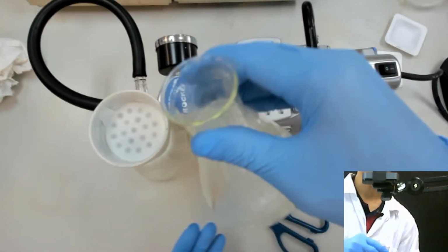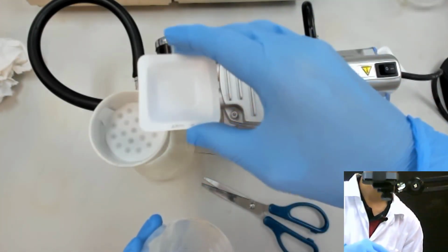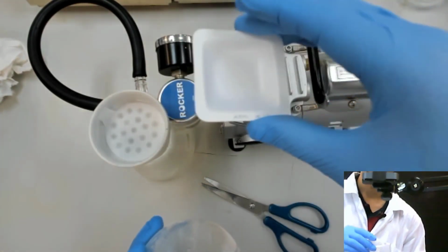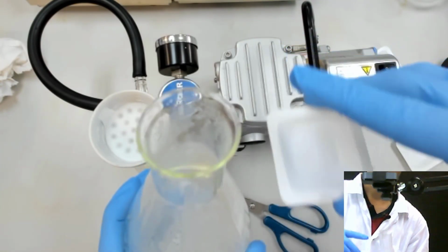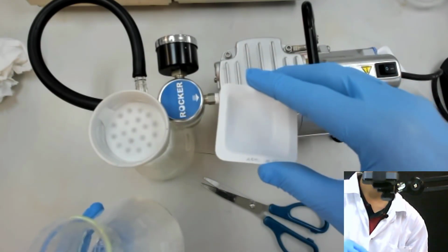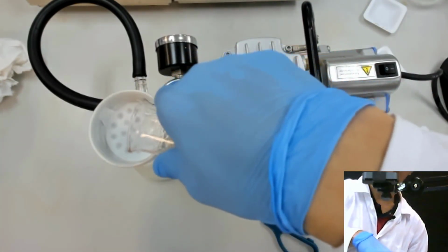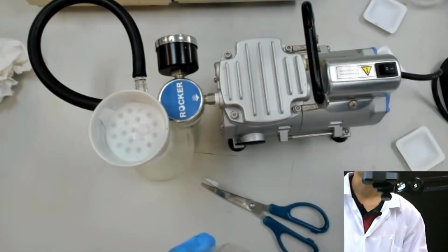So I put it there. The reason why we want to do this filtration is that, let's say before this I weigh this, let's say 3 gram, and then I put it in the flask, and then I do the recrystallization. If the weight of our original is not the same as the weight of what you got after this, then you know that there is some impurity. So that's the reason. Now let's say I swirl it down and then just pour it slowly. So you see there is something, I don't know whether you can see or not, but it's okay.